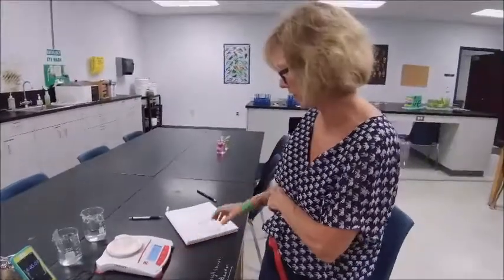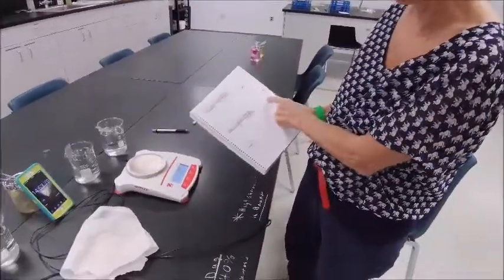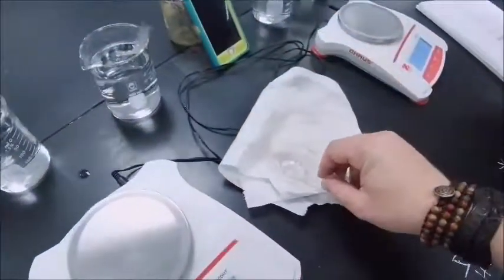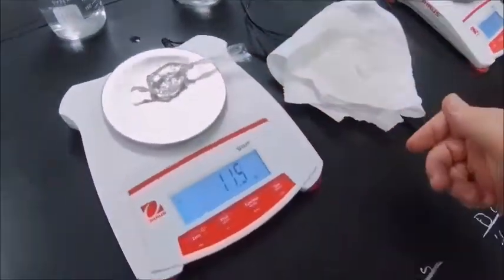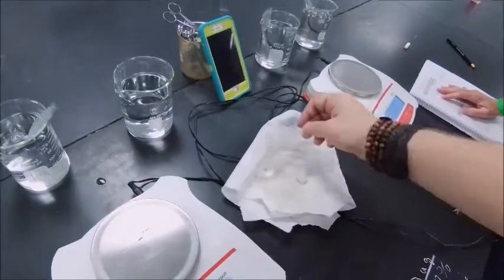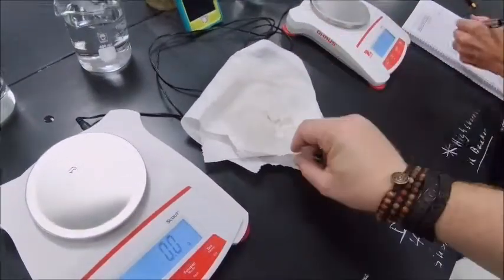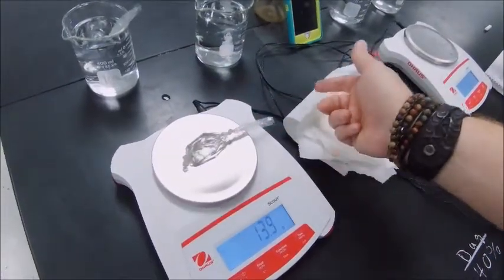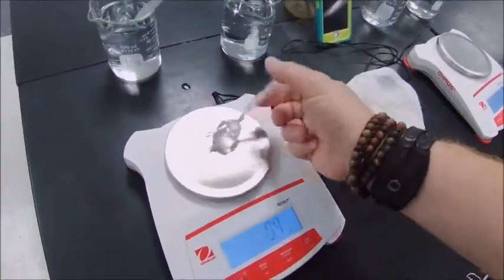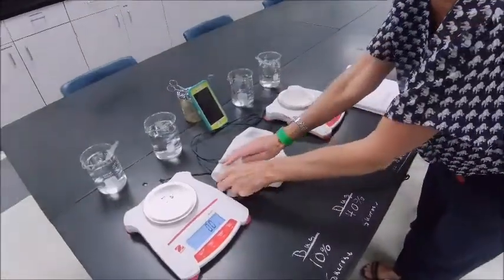Following the lab book on pages 78 and 79, weighing happens at 15-minute intervals. An extra table has been added for the special fourth solution. The procedure: take the bag out, dab it three times consistently, and weigh. The first bag weighs 11.5 grams; the second, 12.1 grams; the third, 13.9 grams; and the fourth, 11.2 grams. That is how you efficiently set up this procedure.